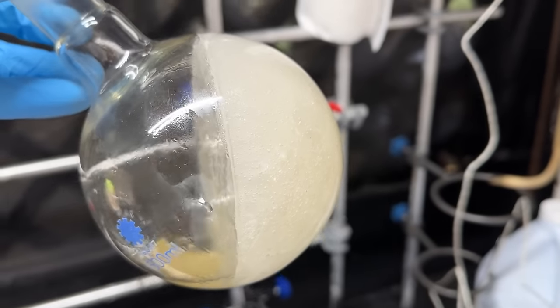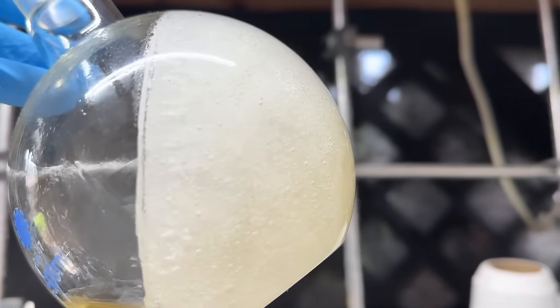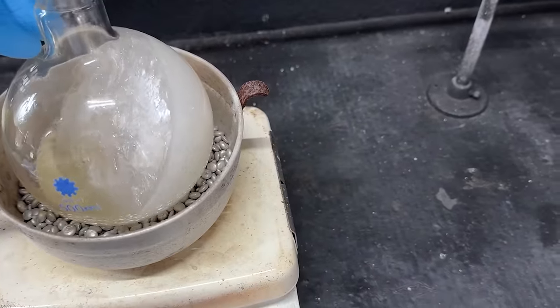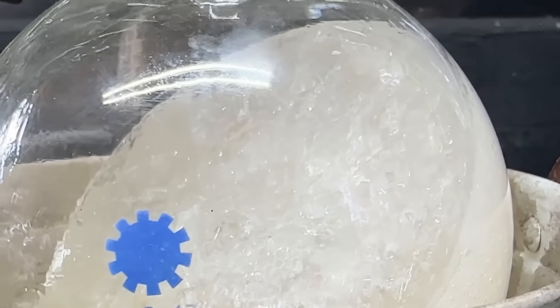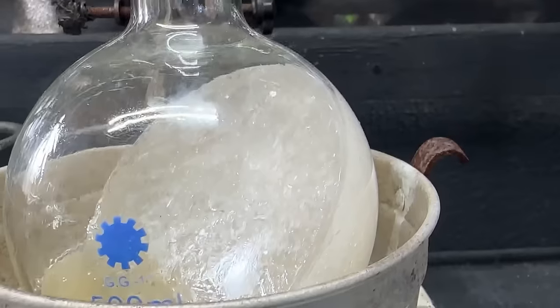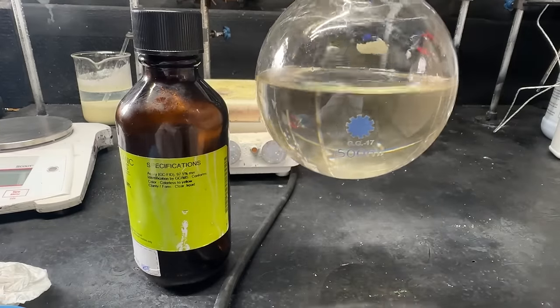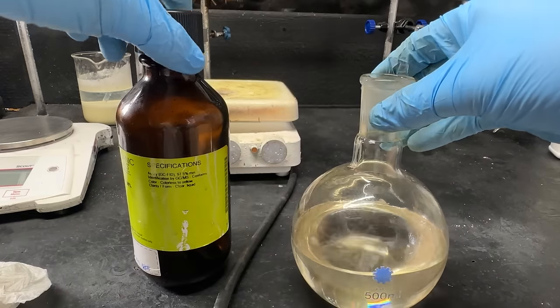Here's our acetophenone — it froze overnight. Part of it does look a little bit yellow and a lot of it looks pretty good. I'm just going to toss it into the hot vessel and melt it back down to a liquid. The crystals of acetophenone in there are beautiful — it doesn't show up well on camera but in person there are some beautiful crystals. Here's our final distilled acetophenone; it's slightly off in color but it's good enough for our purposes.